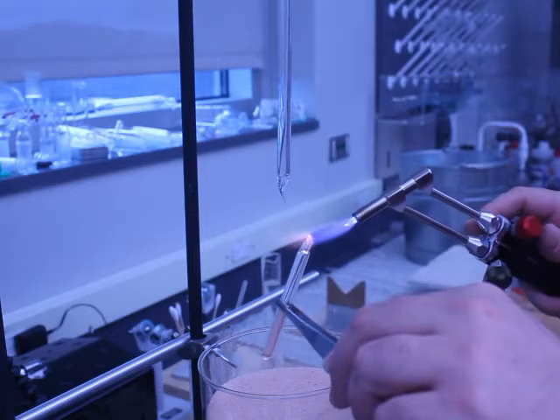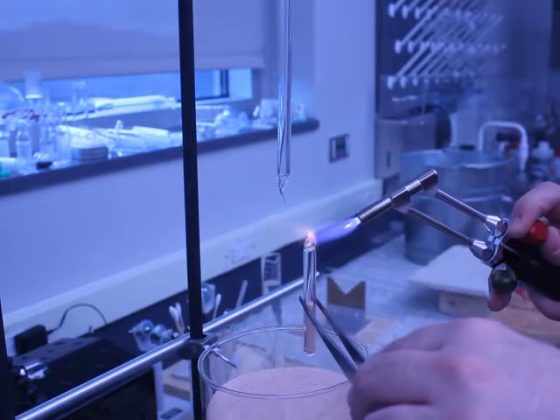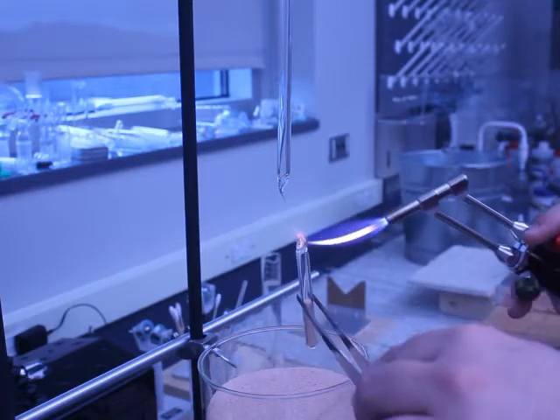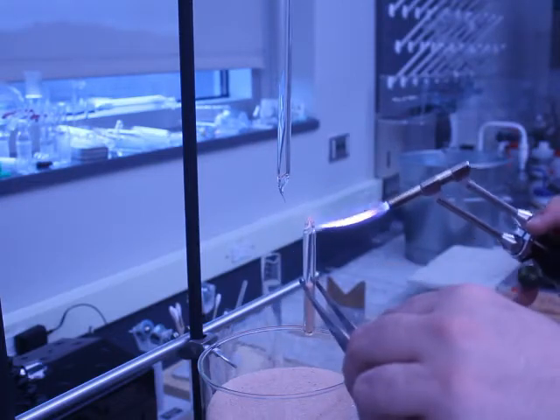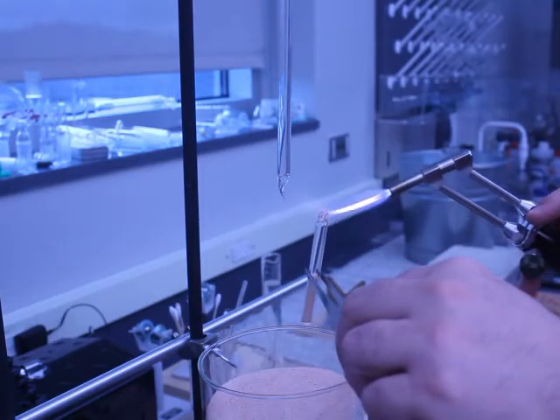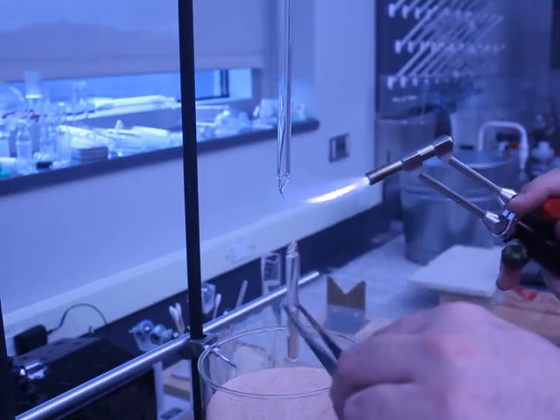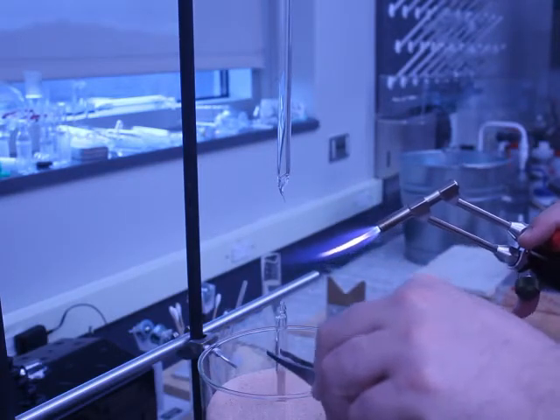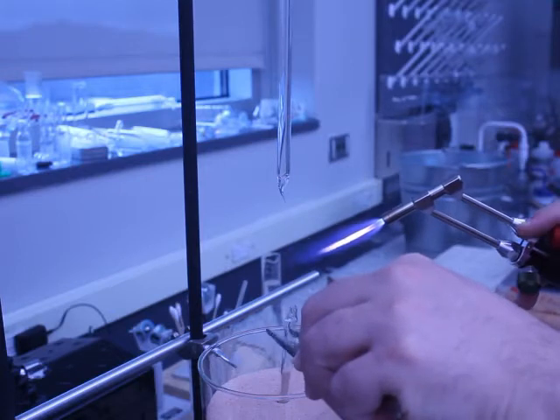And it's always a good idea to just gently heat this up. You can even give it like a little bit of a bushy annealing flame, just a teeny bit to help reduce the stress. You also want to make sure that the end is not pointy. This end I don't really care about. And so now just place it in the sand to cool.